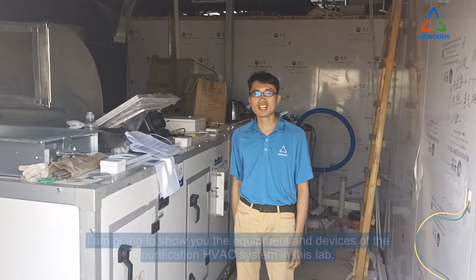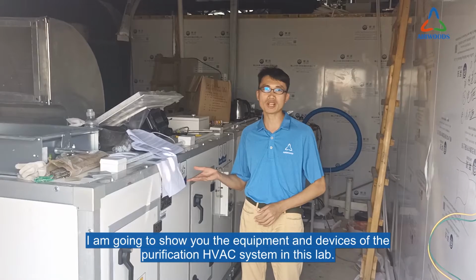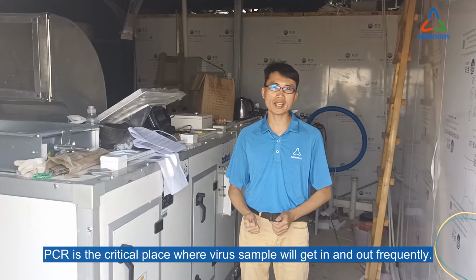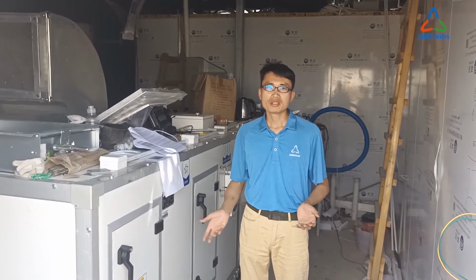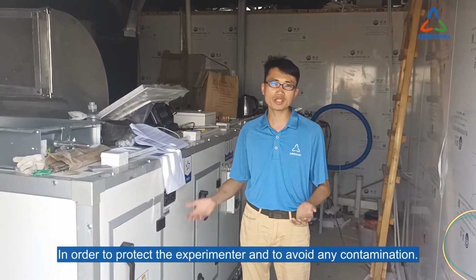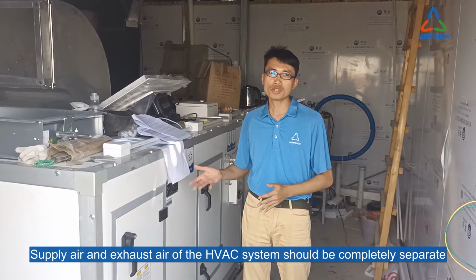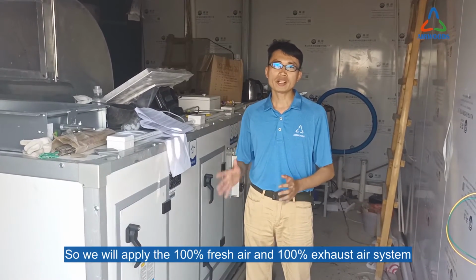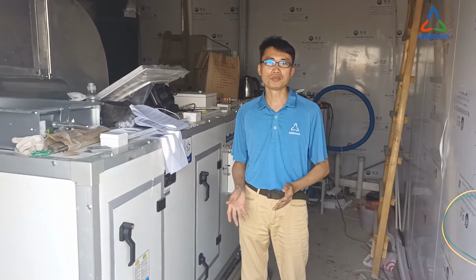Hi, this is Ken. Now I'm going to show you the equipment and devices for the purification HVAC system for this lab. A PCR lab is a critical place where virus samples get in and out frequently. So, in order to protect the experimenter and avoid any contamination, the supply air and exhaust air of the HVAC system should be completely separate. So here we will apply a 100% fresh air and 100% exhaust air system.